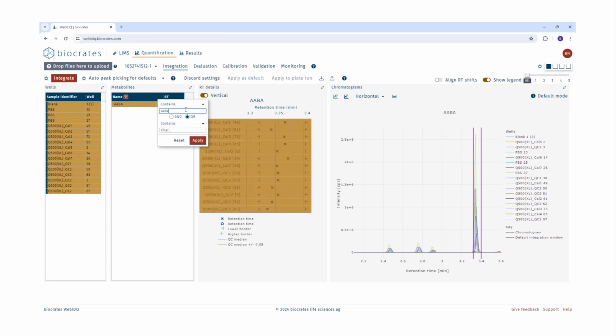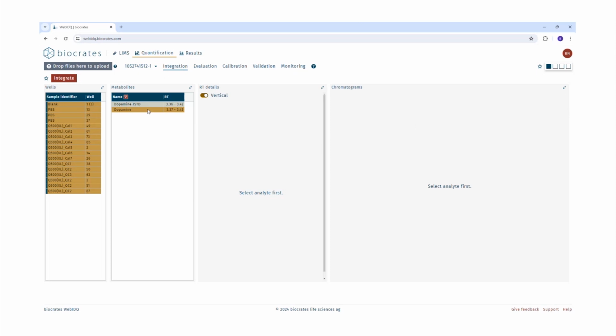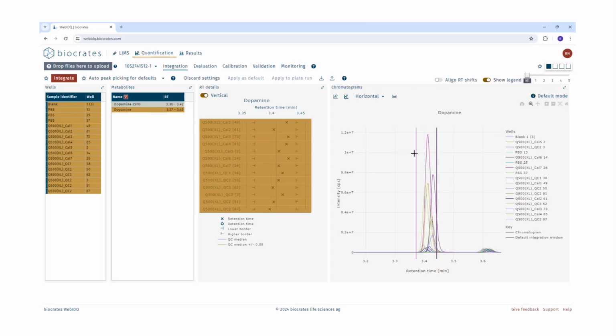Maybe I can take here another example. I define the name of the metabolite and we choose here dopamine. So now you can see that these solid lines are the default retention time windows. And here, because of the shift in the retention time, the peaks are not overlaying on top of one another. It's time to show magic now. Just by activating this toggle align RT shifts, we can see that all the peaks are now overlaying on top of one another.